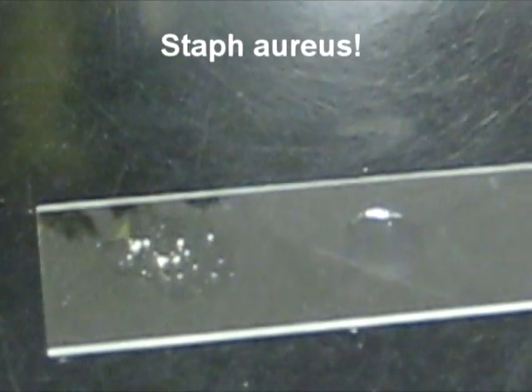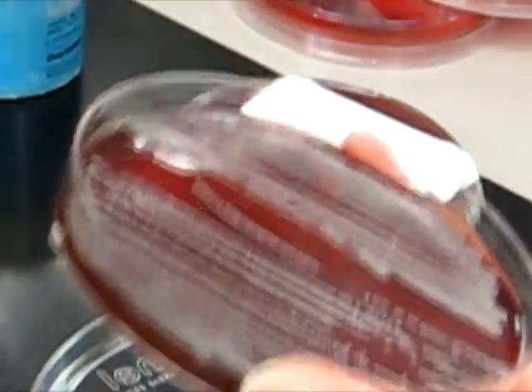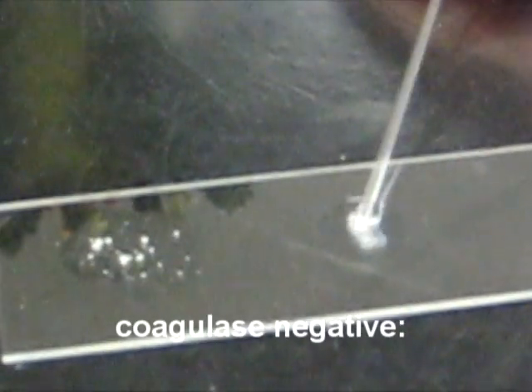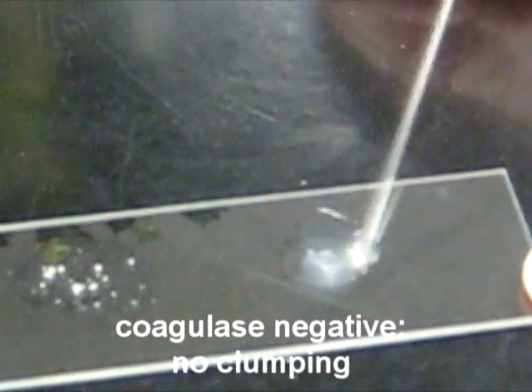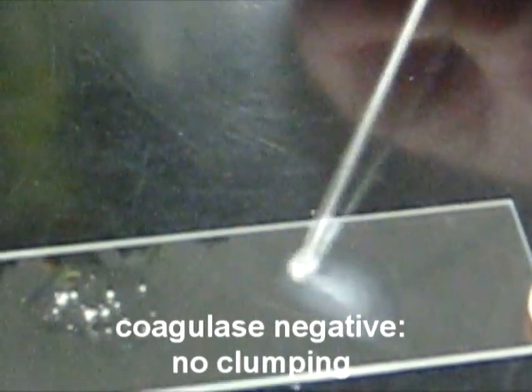Staph epidermidis is coagulase negative and goes into a smooth suspension when you add it to the reagent. No clumping noted — it's very smooth.